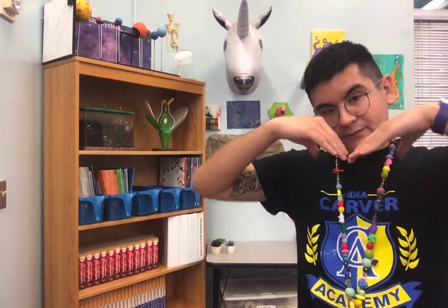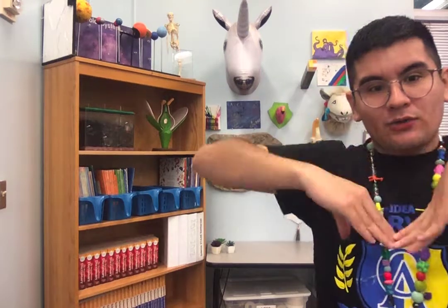We'll be testing density, and let me give you a quick refresher on what density is. If something is more dense, we make an M, and where are we pointing? Down, because if something is more dense, it goes down or it sinks. So when you think more dense, think sink or go down. Next is less dense. For less dense, we make an L, correct? And when we make an L, our L points up because when things are less dense, they go up or they float. So we're going to test the density of the following six materials.